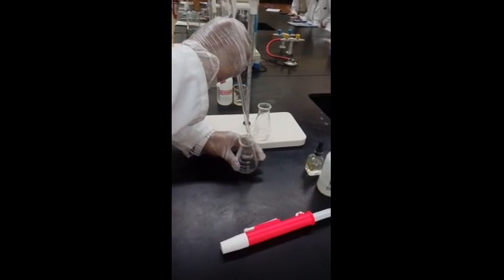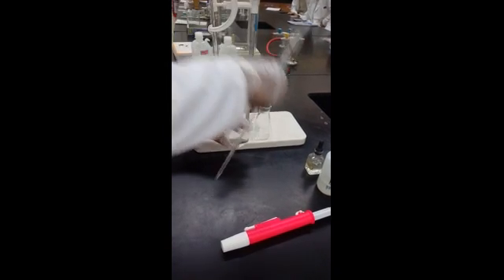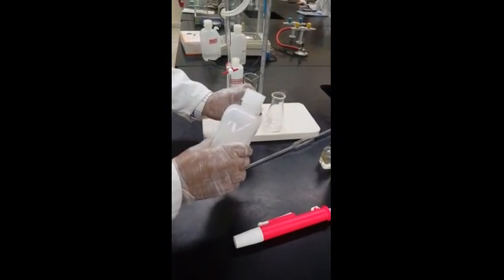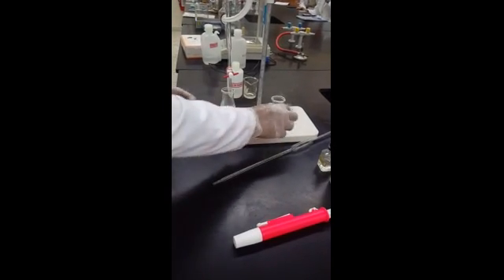You are transferring 20 milliliter unknown acid into the conical flask now. At the end, you have to touch this one to receive any left chemical. And you can see the touch chemical, it is there. So what you do? Take a little water and you can push it down. It will not affect. Bring it here, ready for titration.